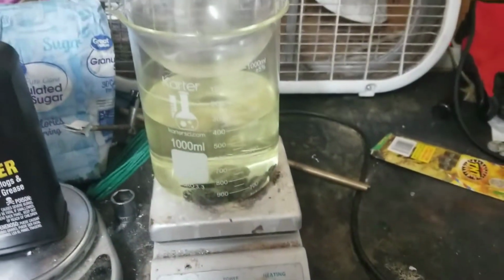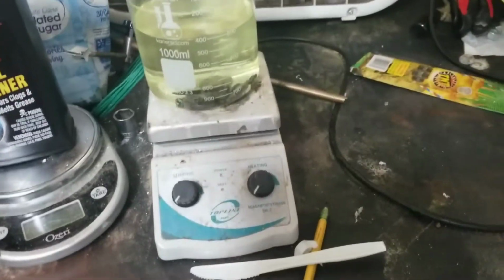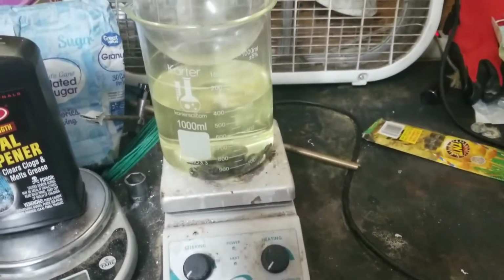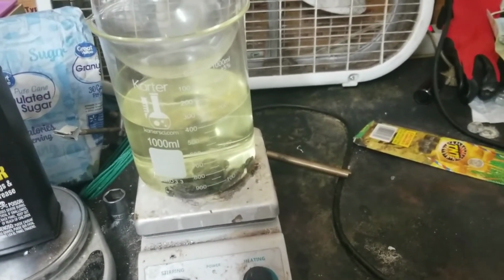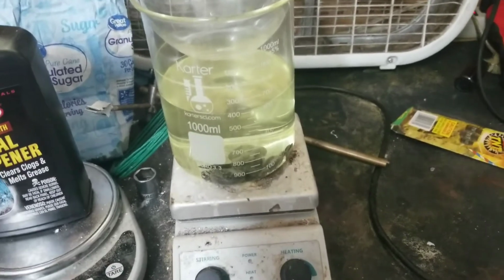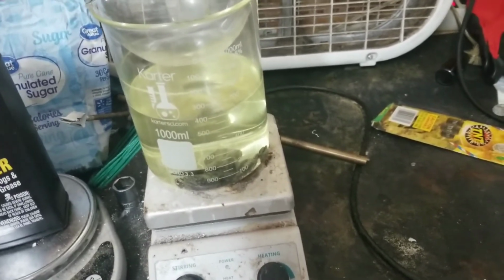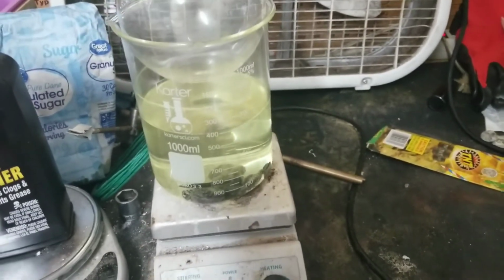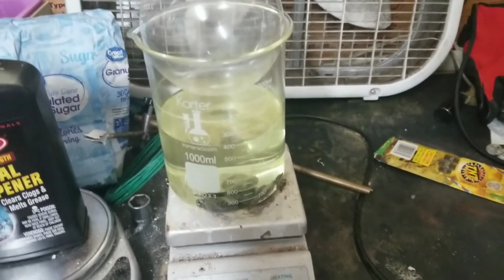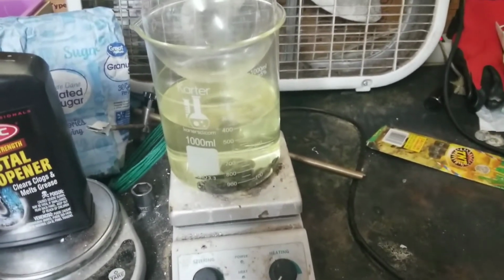And thankfully, we were able to quickly clean it up. So we got baking soda, made a solution, just poured it everywhere. So no one was injured. Everything was fine. It's just really annoying. That's the biggest, most dangerous thing that has ever happened in chemistry for me so far.